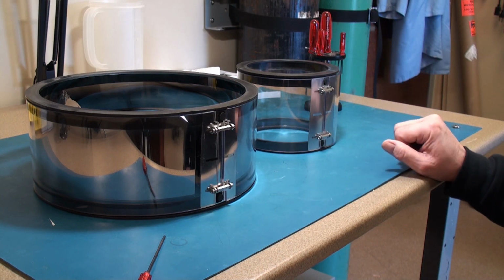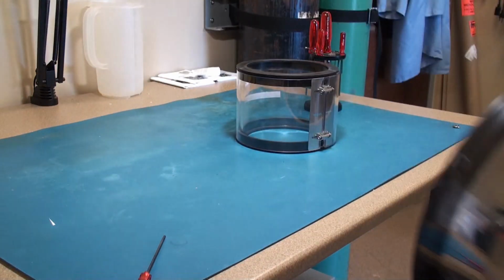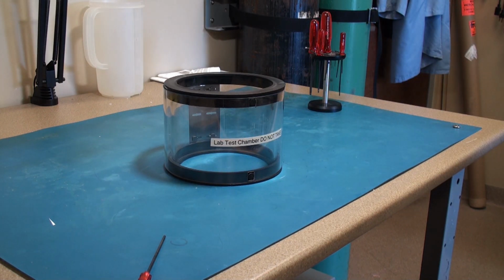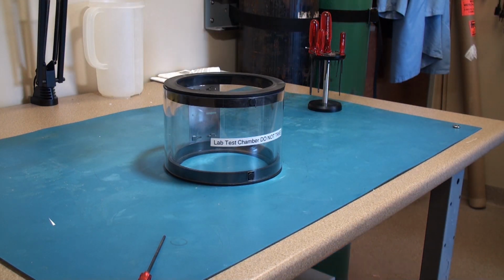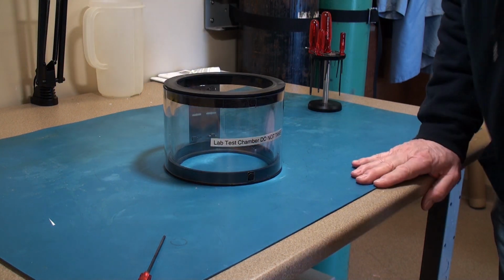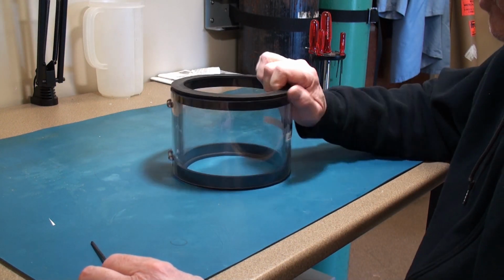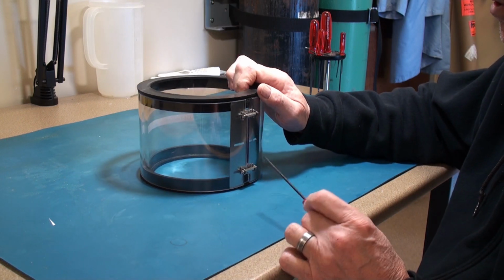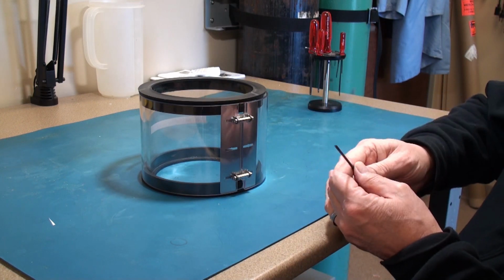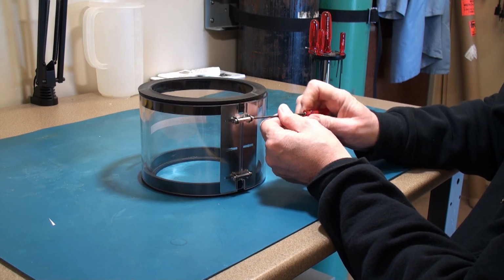The procedure is exactly the same on both, so for ease of operation I will use my own laboratory bell test chamber and return the customer's 300 millimeter chamber to their system, because I do not really want to damage customers' property. These are a bit cumbersome and tricky to replace. You need a 2.5 millimeter Allen key or Allen key screwdriver.